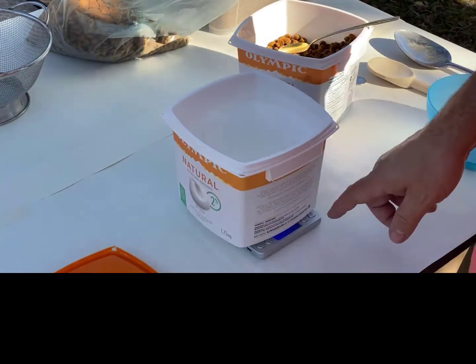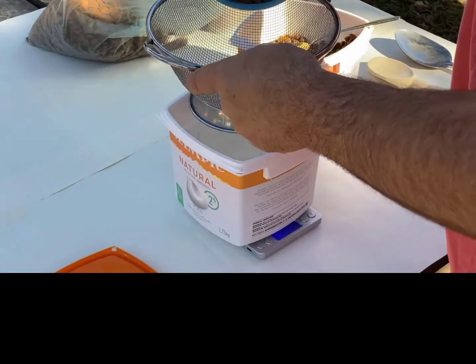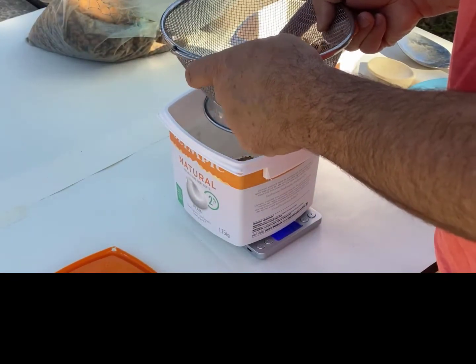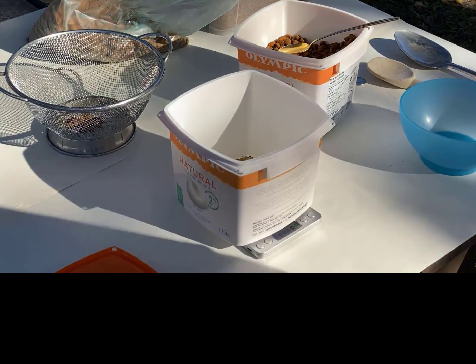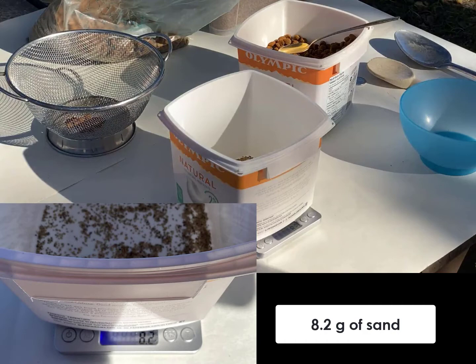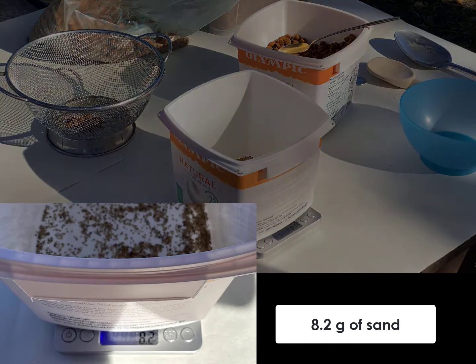We put a container onto the balance, zero it, and then using the sieve, transfer only the sand into our container. The result is 8.2g of sand. We're off by 1.9g, or 30%.